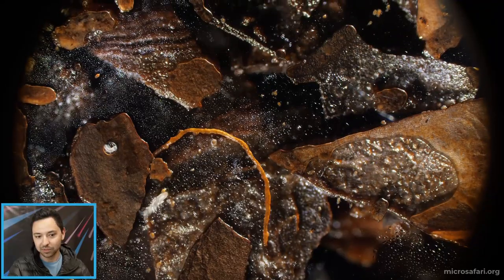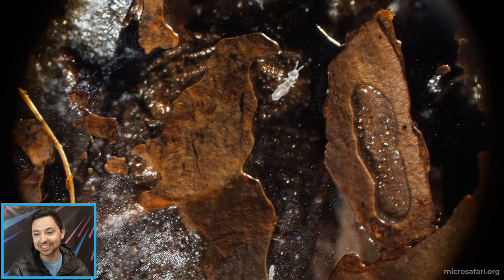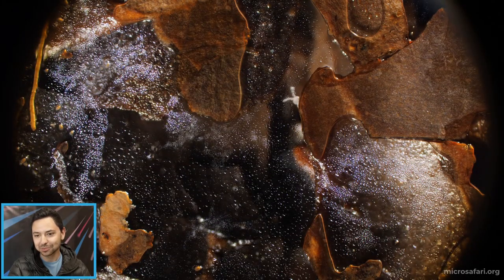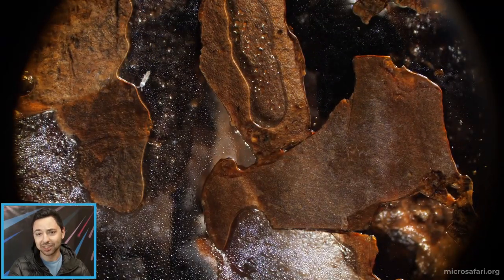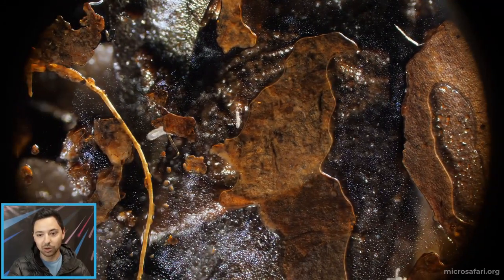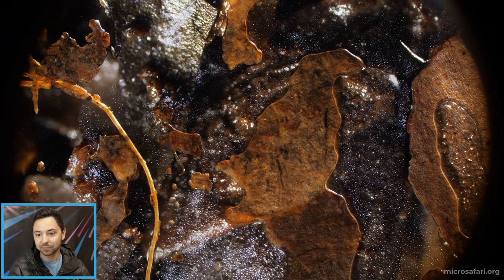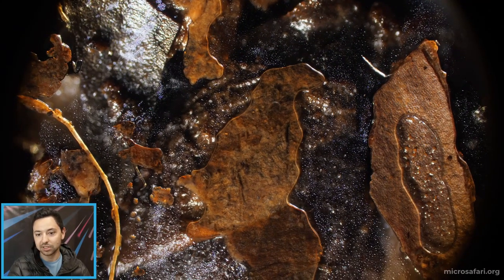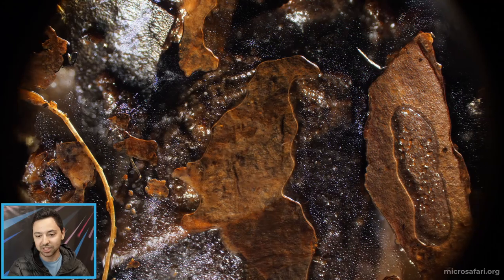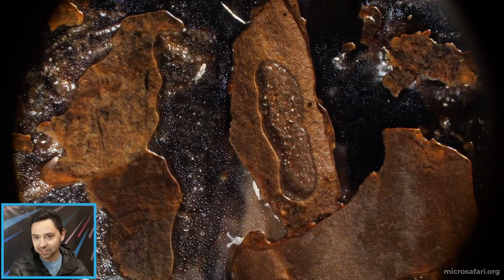These little springtails that are running around look like insects but they're not really insects — they're hexapods technically, very closely related to insects. They sure do run around a lot like insects. Easily the most common organism inside these micro safaris; I don't know what it is that makes them so favored to these environments, but in almost every single one I've made they always tend to be the most common population. Probably second to that are these little nematode worms — you can see this little guy running around, they just kind of wiggle around, that's what they do.